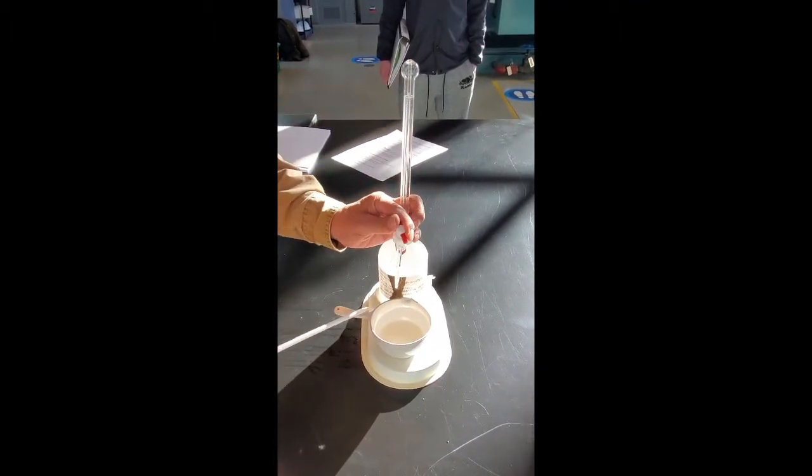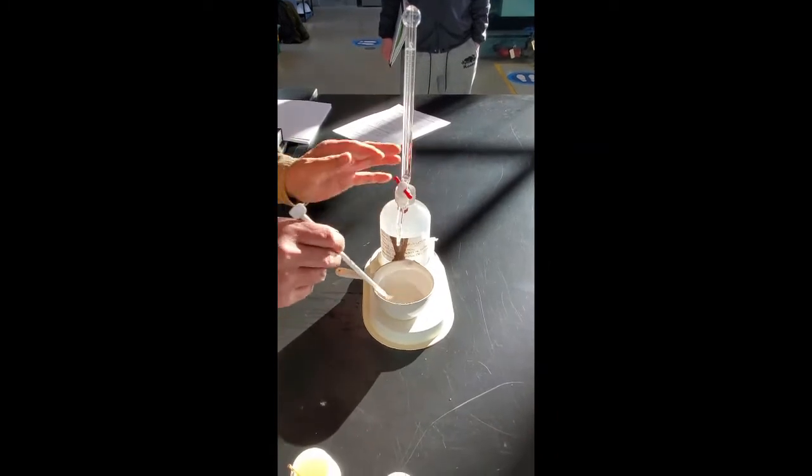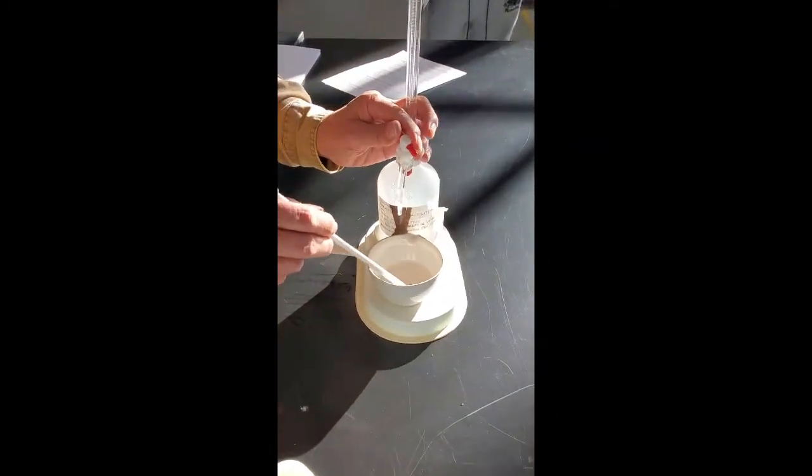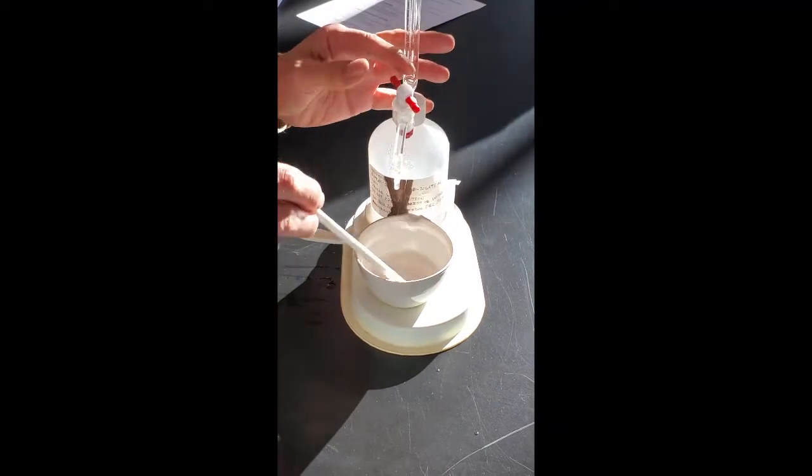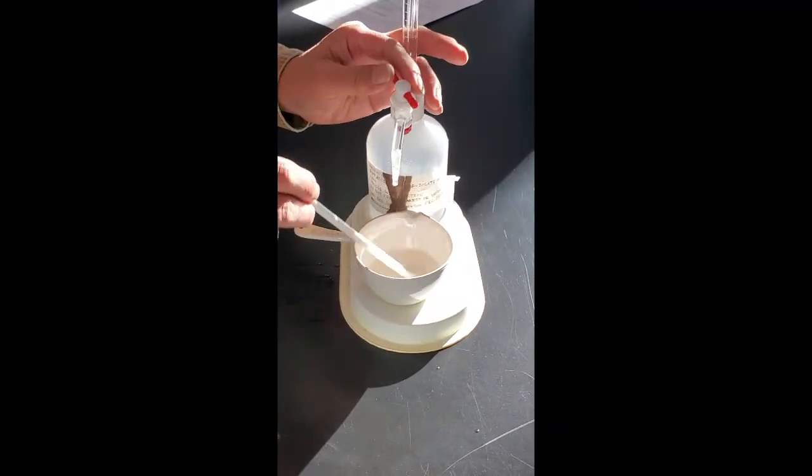You see the color change to black, but it's not permanent. We want a permanent color.